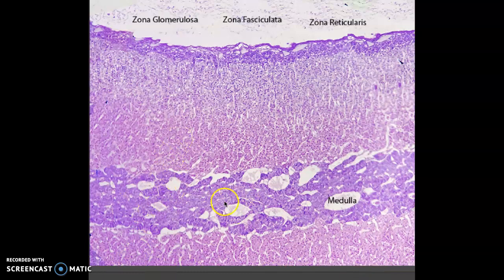Basically, this is the medulla, it's the center. We have this, and it repeats itself down here. Now, the zona glomerulosa, oops, where's my brush tool? Sorry, is right here. So that's the zona glomerulosa. Let's try that again. So that's the zona glomerulosa. And it's a really dark blackish. This is why I called it the chocolate zone, is it's really dark on your slides.